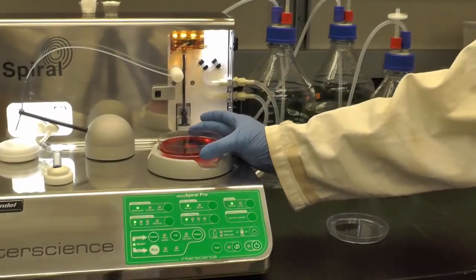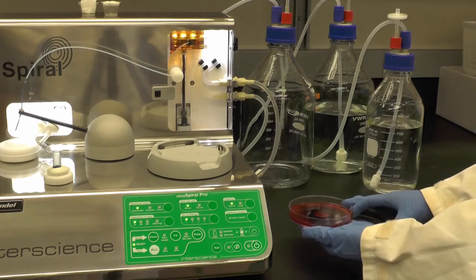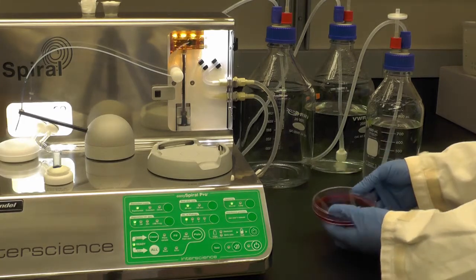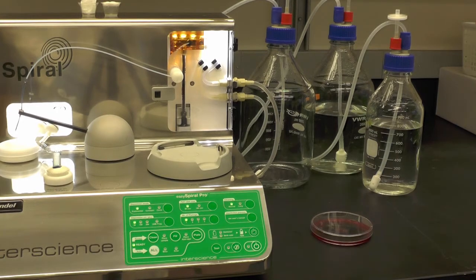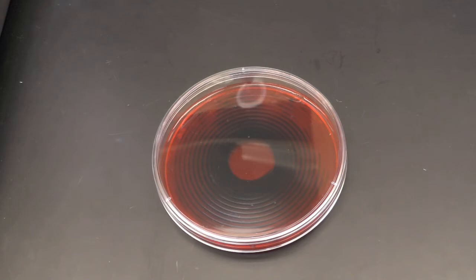After the plating is complete, put the lid back on and slowly transfer the plate horizontally to the bench top. Avoid disturbing the exponential pattern on the agar. Wait until the plate is dry before inverting and incubating it as needed.